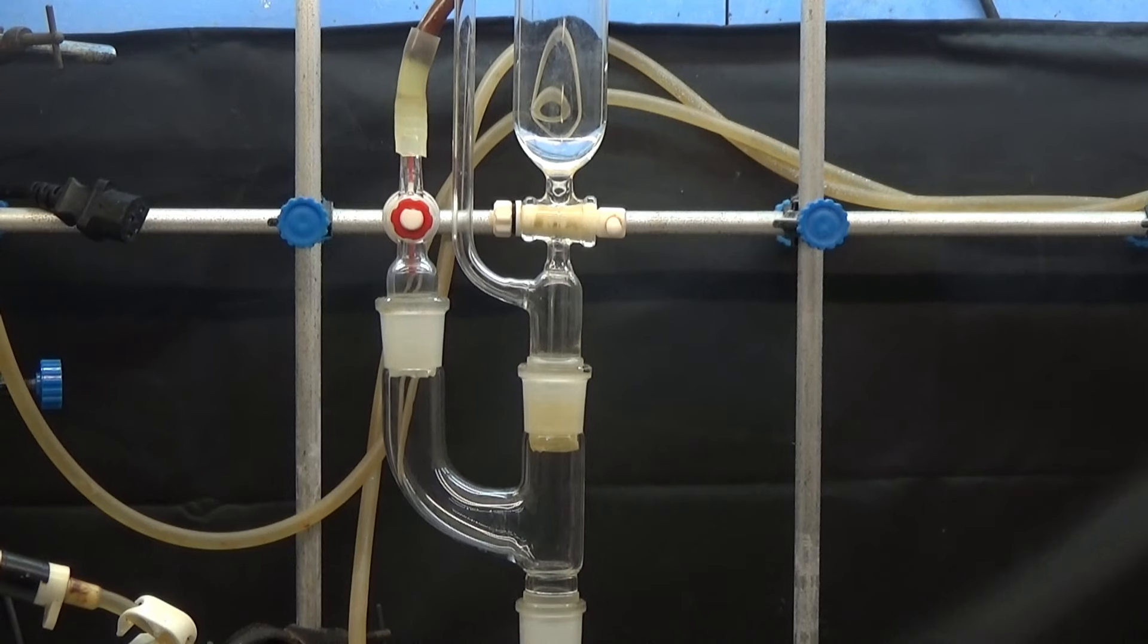A 125 milliliters pressure compensated addition funnel, and an outlet to the fume hood to eliminate the gases produced.